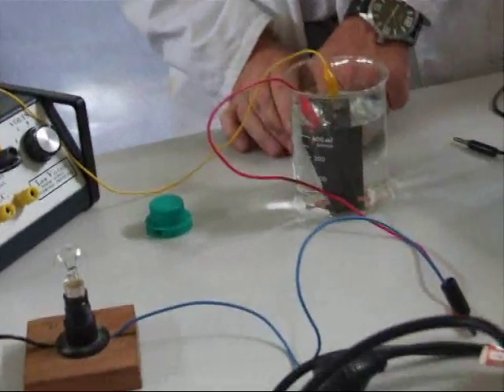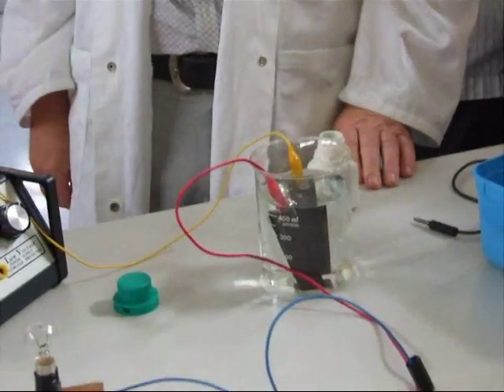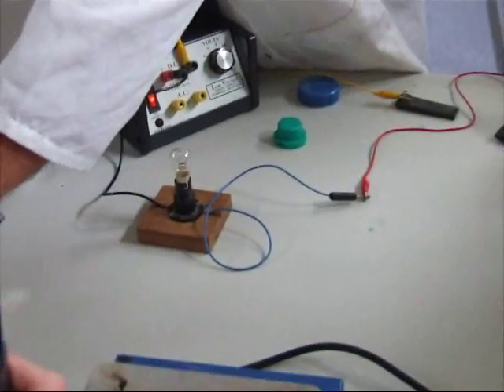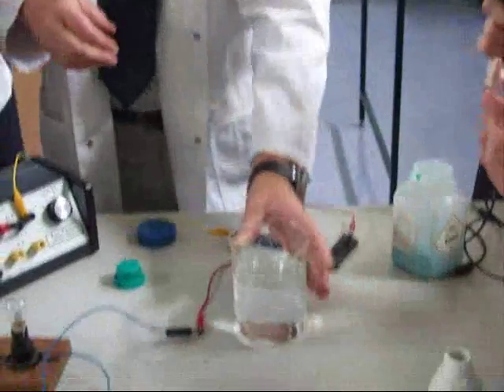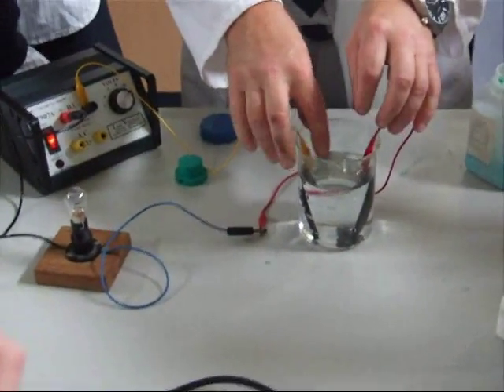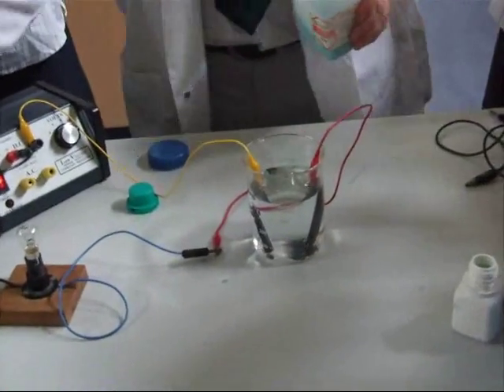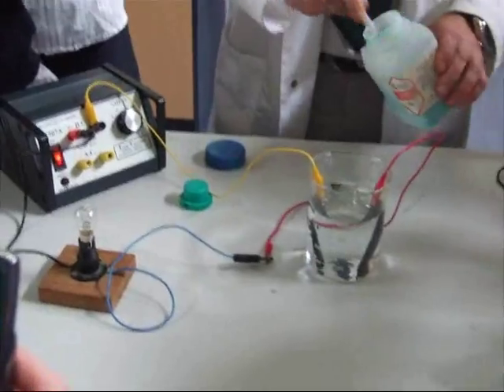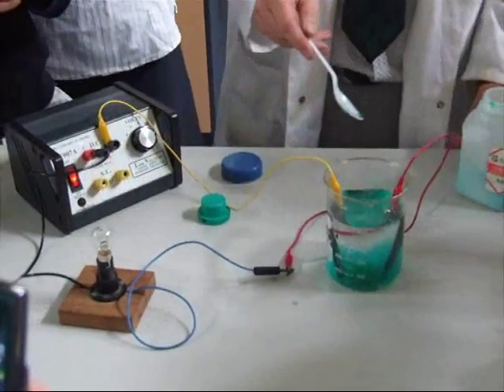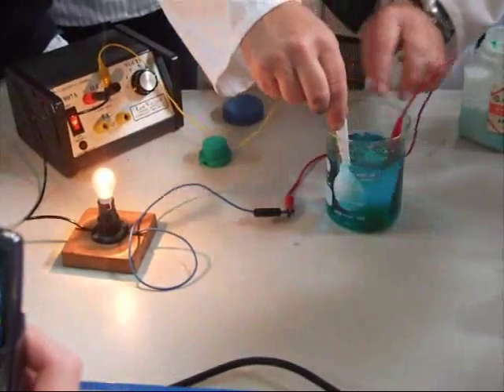This is Green Bay High School copper chloride. It's been sitting in that cupboard since 1952 and it's gone solid. The question was, does water conduct electricity? And the answer is no, it doesn't. But let's put some ions in there, courtesy of copper chloride. We're going to put some copper ions and some chloride ions in there. The water will dissolve this stuff, and the moment we get ions in there, that water is conducting electricity.